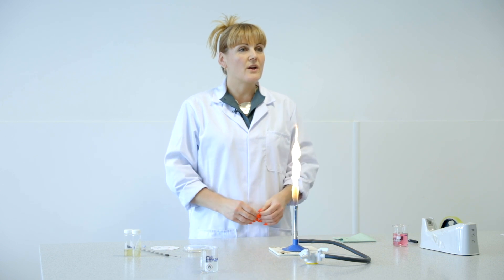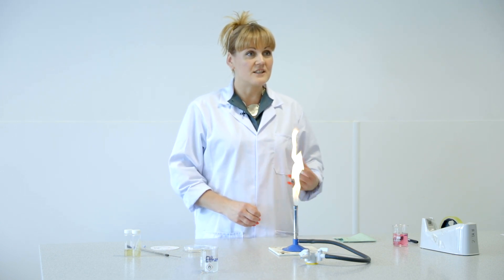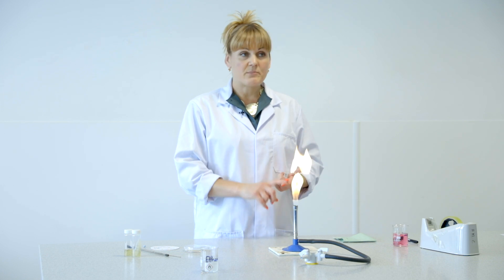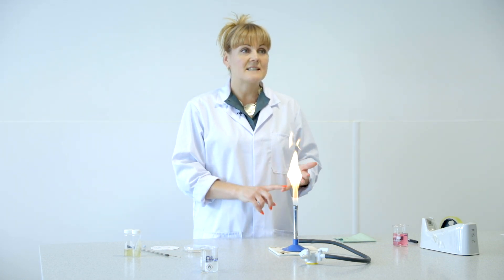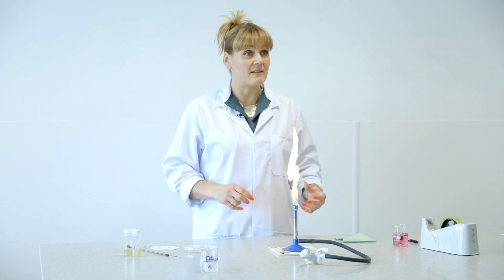Hello, my name is Kerry Stones and I'm the course leader for Applied Human Biology. The coursework in the first year will consist of Microbiology, and you will learn lots of different practical skills including spread plates, pour plates, streak plates and smear slides. I'm just going to do a quick demonstration of a streak plate for you.